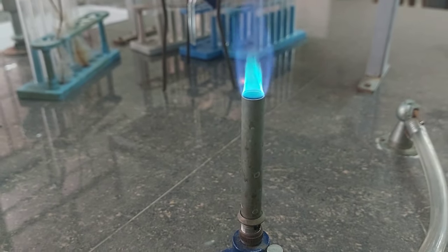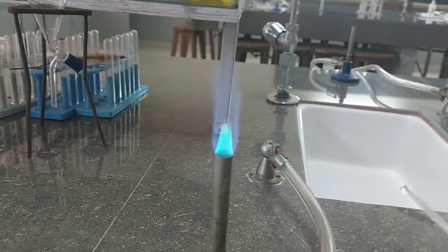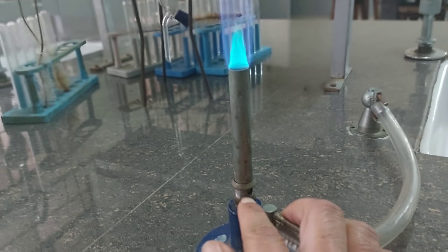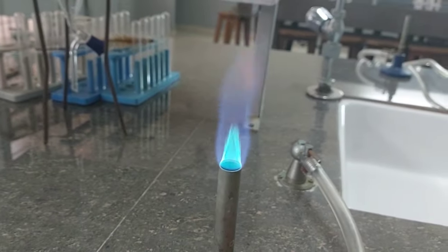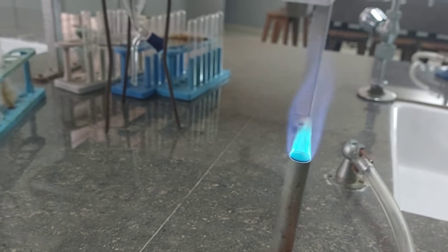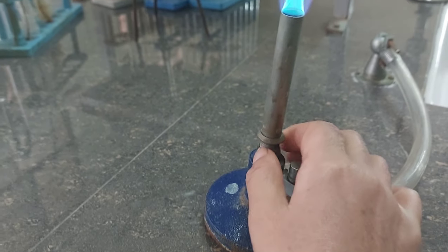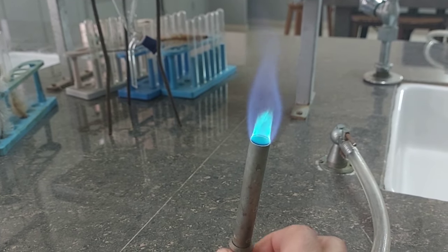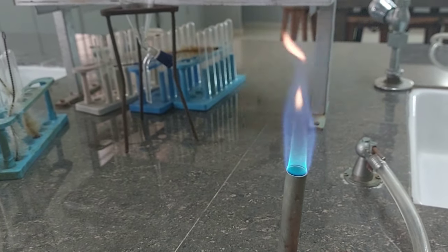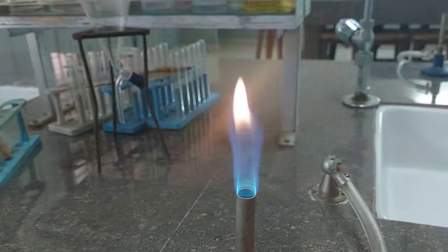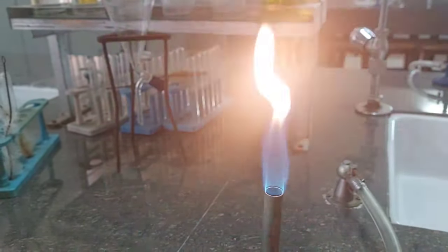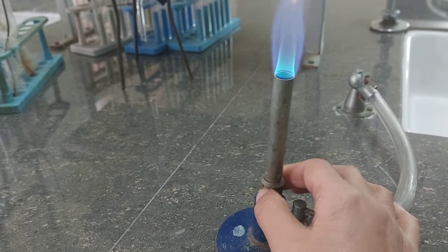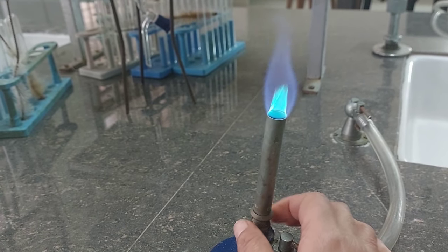Oxygen and the gas are going to undergo combustion and we get this part as the flame. Now see carefully, if this hole is wide open, it lets in more oxygen through it and you see a more clearer blue flame. Now if I start rotating this valve upwards to close it, that means less oxygen. You can see the flame is becoming yellower. This shows less oxygen, incomplete burning of the gas. And again I move the screw downwards to allow greater inflow of oxygen and see the flame turn back to blue.